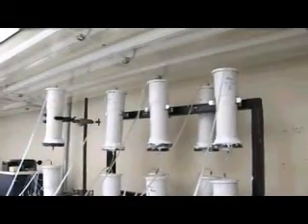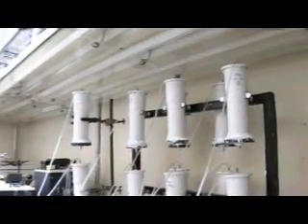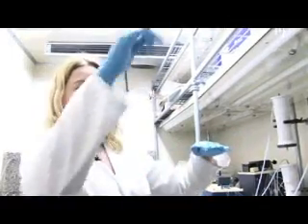These ones are where I'm having a much more rapid flow rate. And I run these for the same amount of time as these, and put the same spike through. So effectively, you've got the scenario where it's low flow rate spike and high flow rate spike.